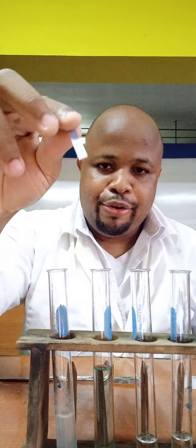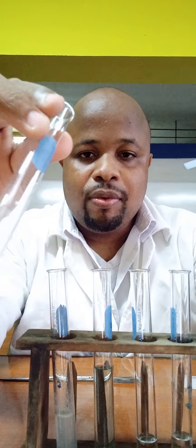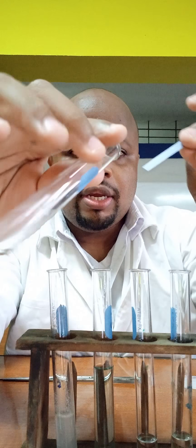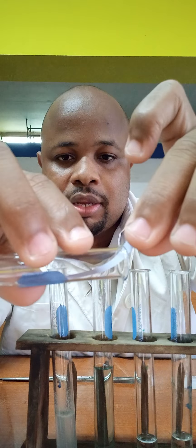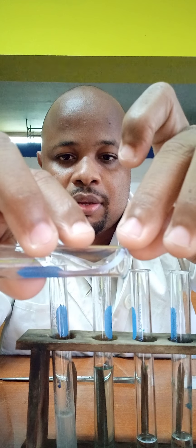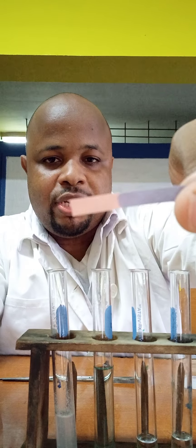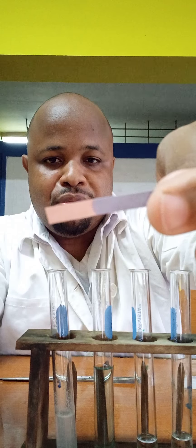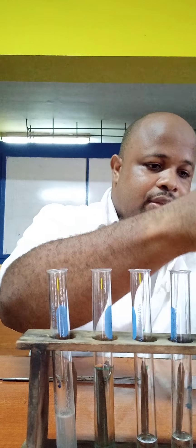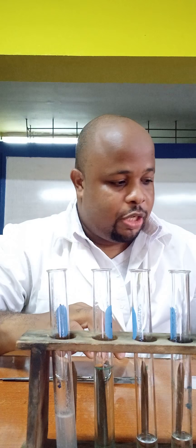Using a new piece of litmus paper, let's now test it with liquid B. As we can see, liquid B changed it from blue to red. So that's the result for the litmus paper test.